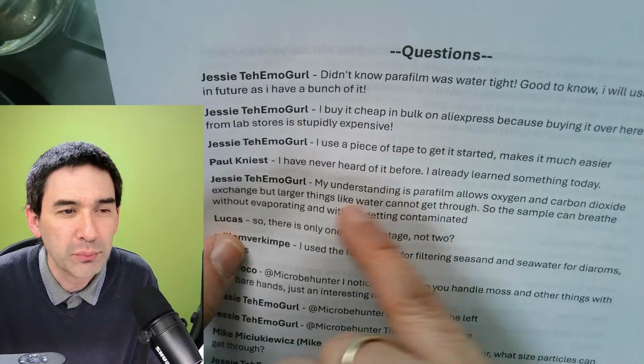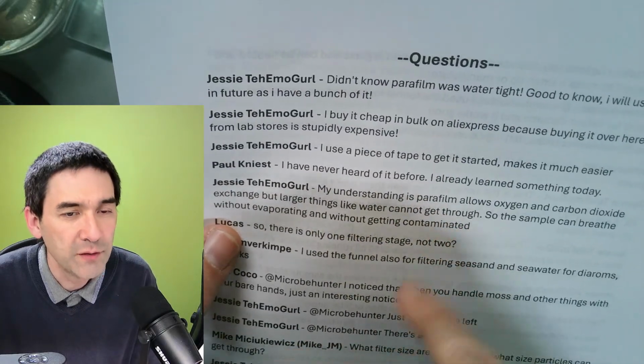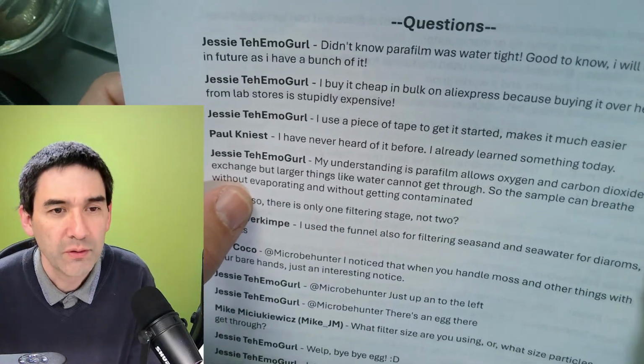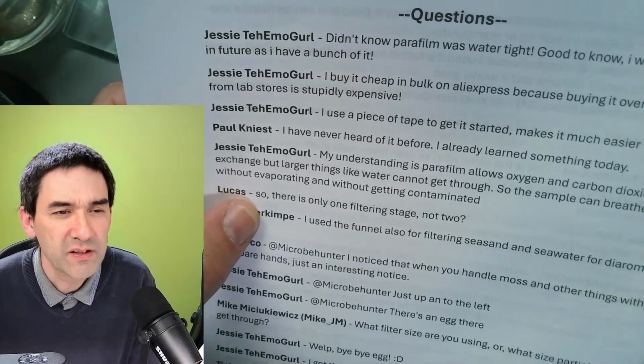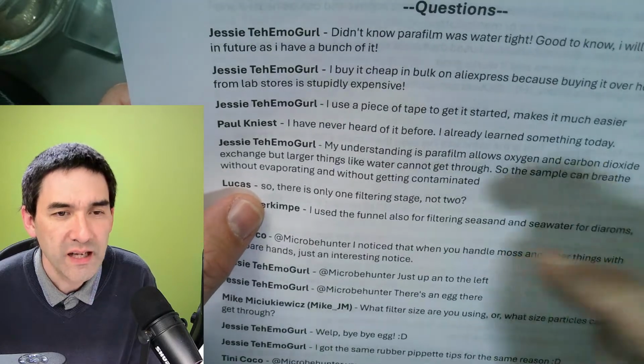So the sample can breathe even without evaporating and without getting contaminated. Oh, thank you for this information. Yeah, so parafilm is therefore quite useful, but you have to be careful because I think it does not withstand some of the solvents. Is there only one filtering stage, not two?